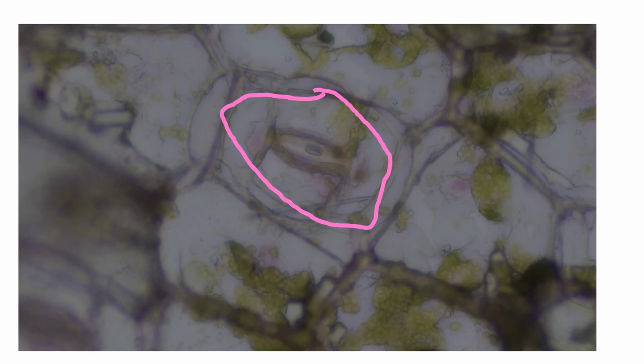The area that circle inside of there. And so it kind of looks like a mouth to me. This one in particular looks like an eye because of that center spot. It's not like a fully clean section, so it's just some remnants built on top of the specimen that I peeled this off of and took it. That's why it kind of looks that way. That's not really typical. But what is typical are these cells you can see. And so it can be closed mouth or an open mouth, depending on if the stomata was open or closed.